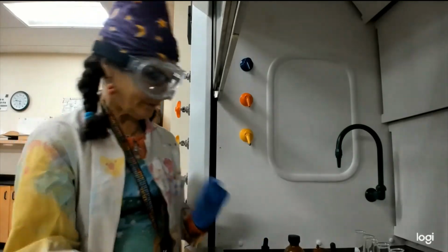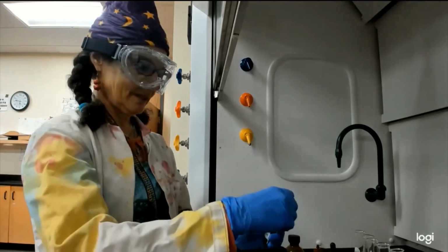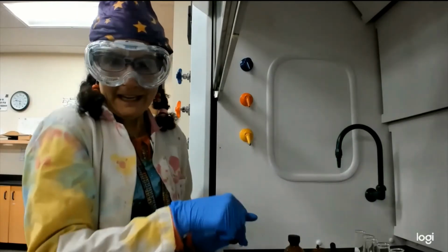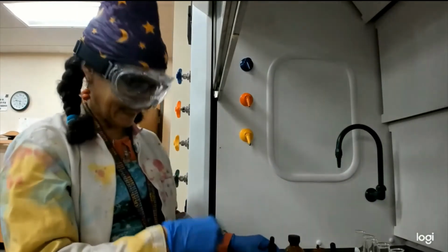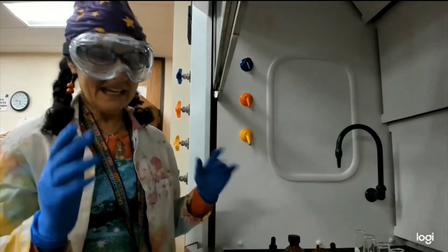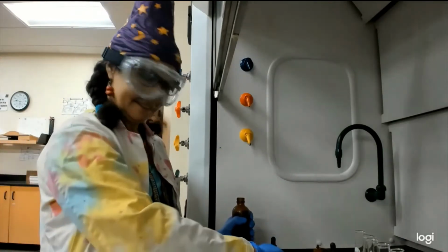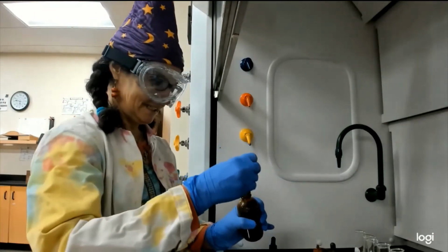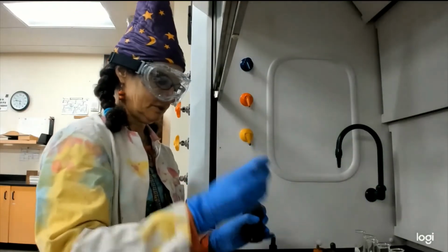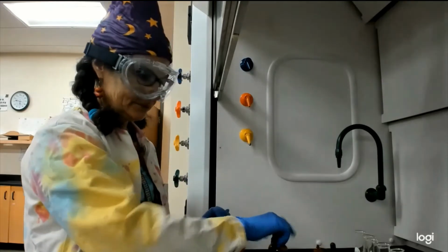So for each test, we take something. First container is the butanol. We add 1 drop. Now butanol, we all know, ends with OL. It's an alcohol. This is a test for aldehydes and ketones, for a double bonded O. And then we take butanal. The AL ending means it is an aldehyde, and 1 drop will do. So only something with that carbonyl group, an aldehyde or ketone, is going to react.